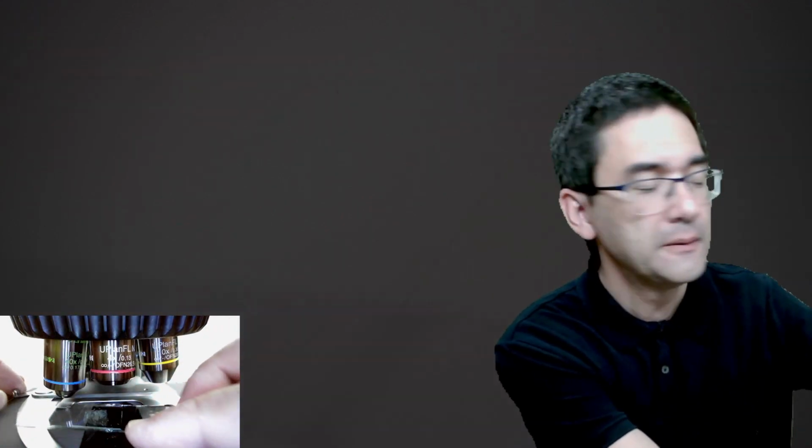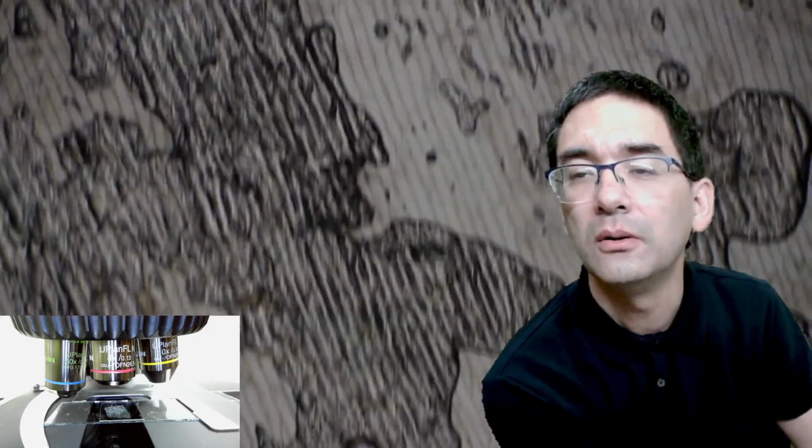Let me also turn on the light here. Up, no, it's not in. Now it's in. Let's center everything here, and it's a little too dark, so let's go up with the brightness. Let me try to find a nice place first.